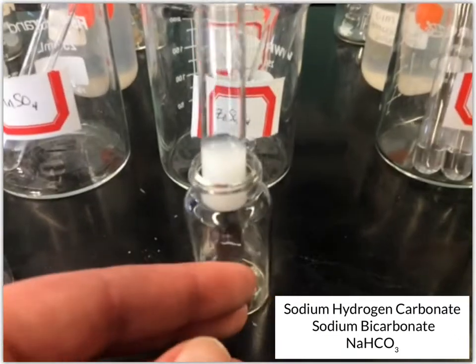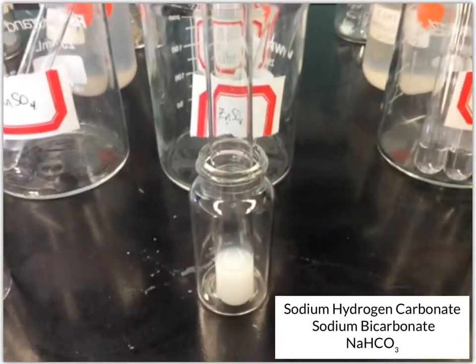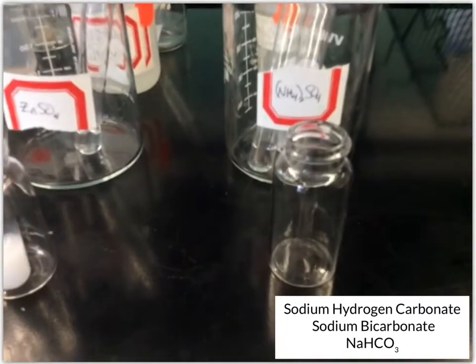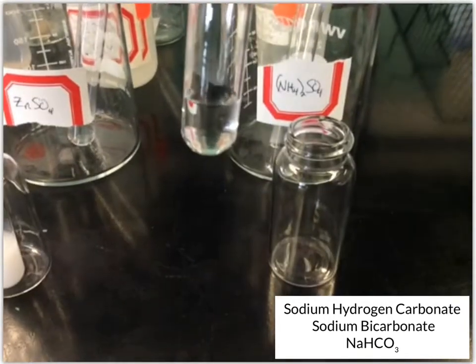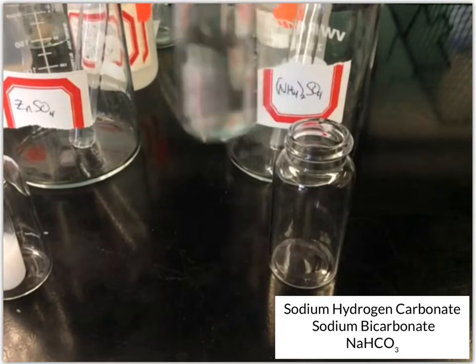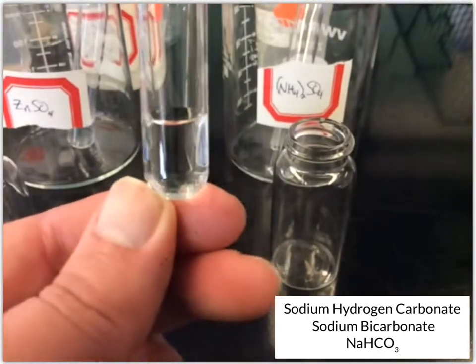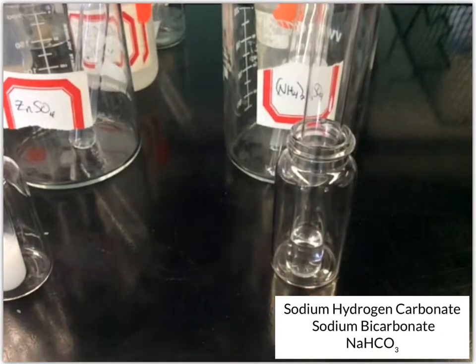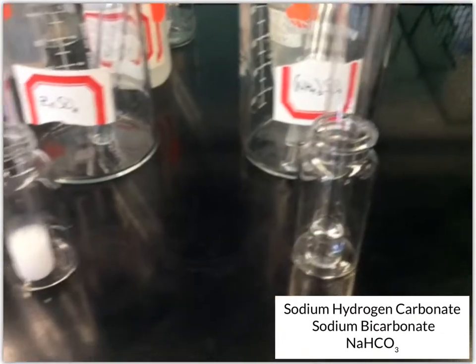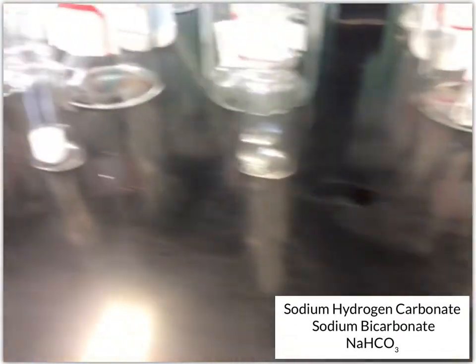So we'll let that one settle as well. Then we've got ammonium sulfate. And that one looks like no change. So again, let's go back and look at these.